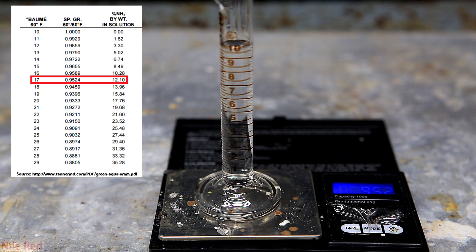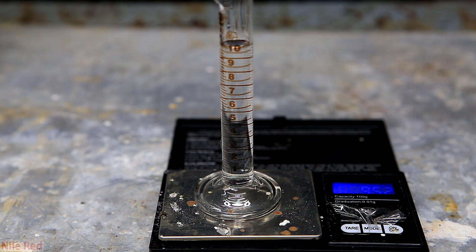Commercially available ammonium hydroxide is at about 28%, so we're about halfway there. To get it more concentrated, we could have just let more ammonia bubble through it. However, I already have concentrated ammonium hydroxide, so I wasn't too interested in doing this, but I was pretty eager to start generating some anhydrous ammonia. So that is exactly what we're going to do now.